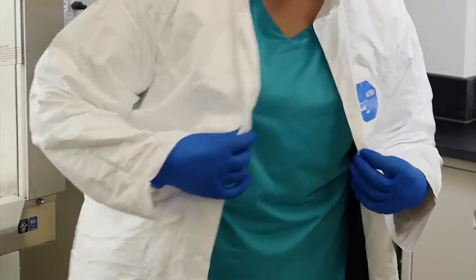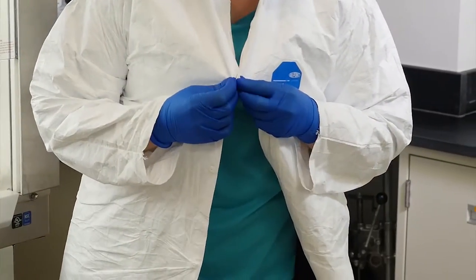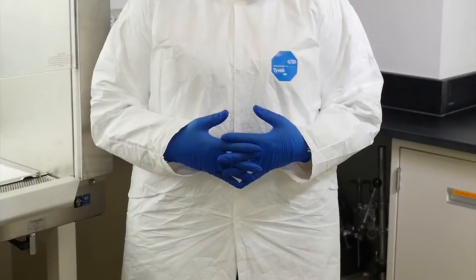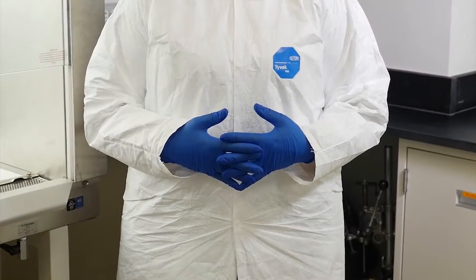Prior to preparing the workspace and working with your sample, put on your personal protective equipment including gloves and a lab coat. Remember, your safety is first.